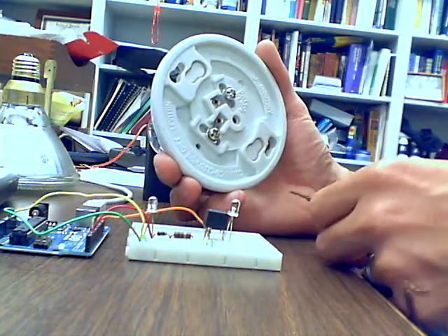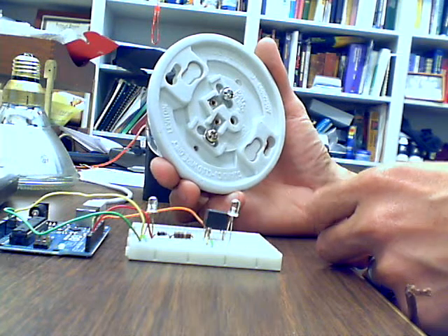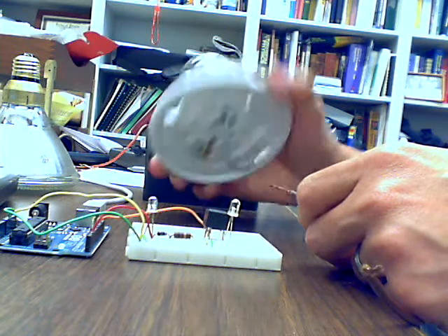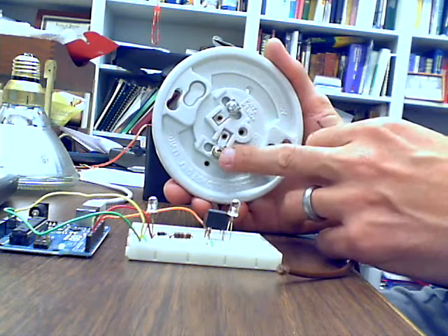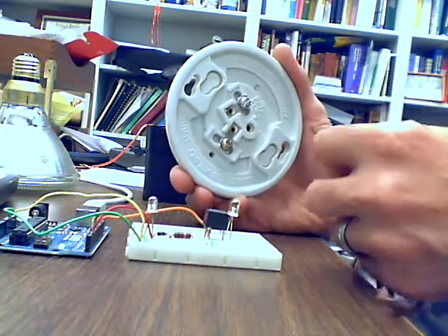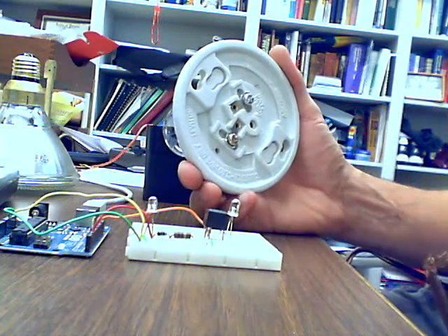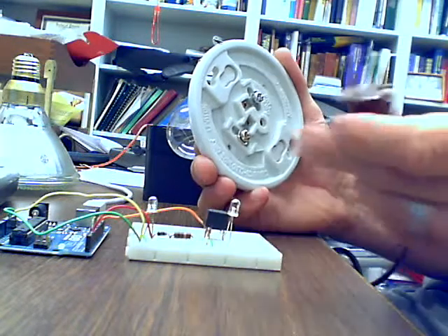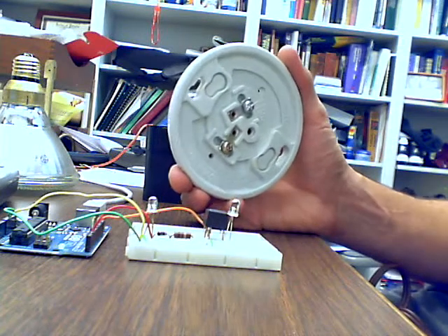The light doesn't care. In most electrical situations, you want to be aware of your hot wire and your common wire, but this isn't a polarized device, so it doesn't matter. These are actually color-coded. One's more of a copper color and one's more of a silver color, if you do want to keep that straight. But with my lamp cord, because it doesn't have a polarized plug with a larger side, I don't know which side's what, so I'm not going to worry about it.